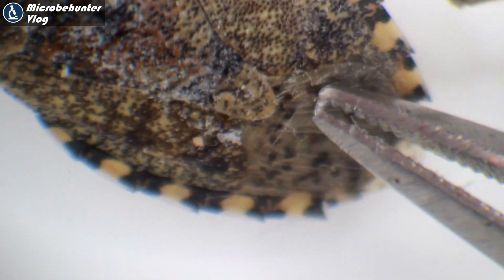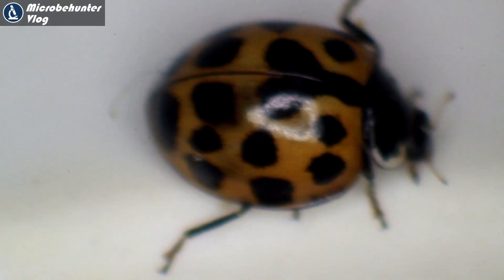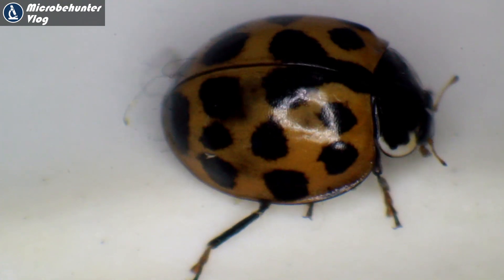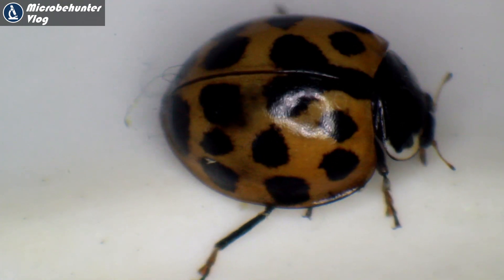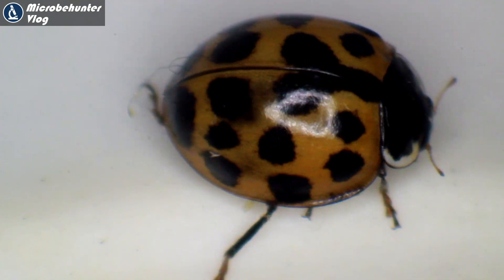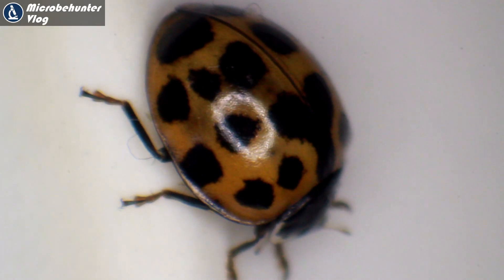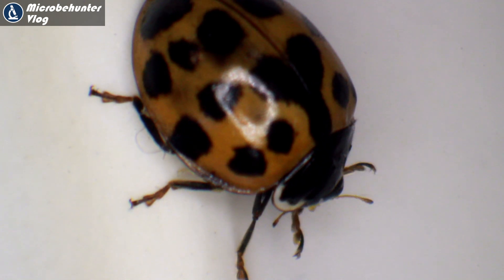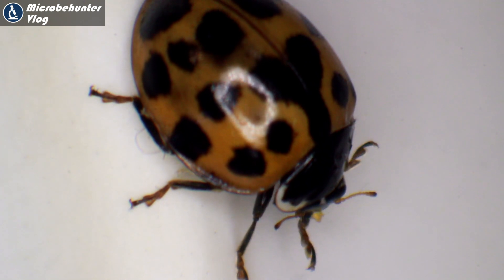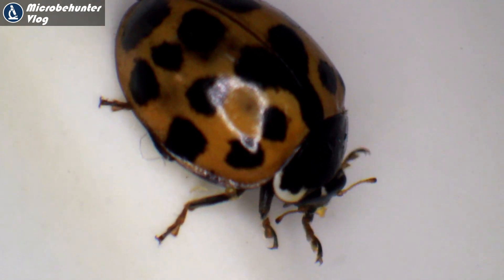A beetle like this ladybug has a front wing that is not membranous at the back — it's actually hard all the way through. This ladybug I found running around on my windowsill does not have a trunk, so it has mandibles; therefore it is a beetle. Here it's trying to clean off some dust.